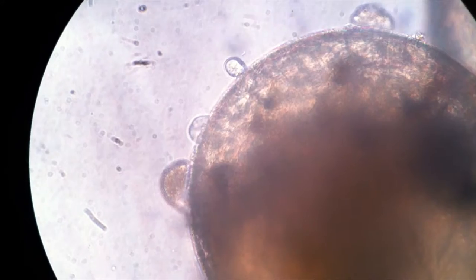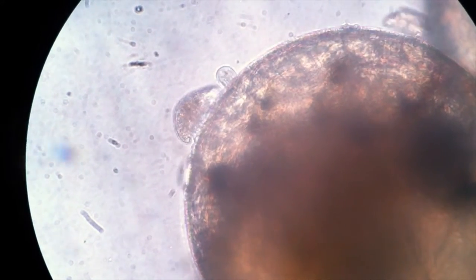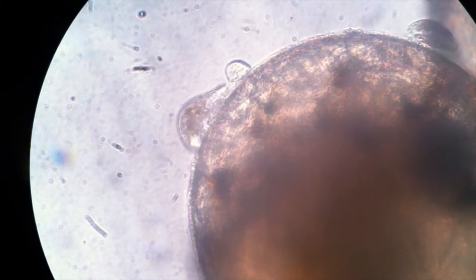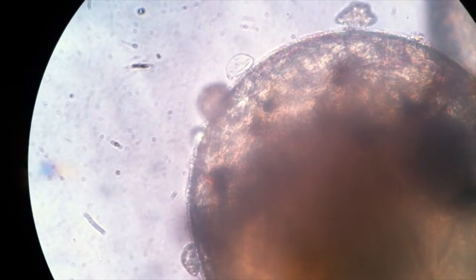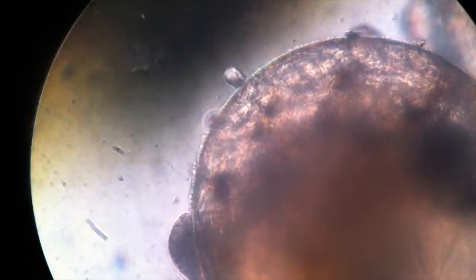It's one of the things I love about scuba diving — you're going into this foreign world and you're seeing things that you're not used to seeing. Well, it's like that underneath a microscope as well. Just an amazing world we live in.